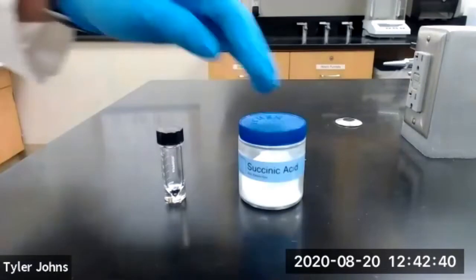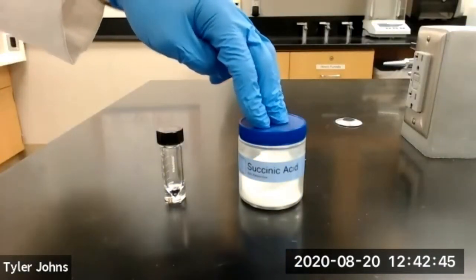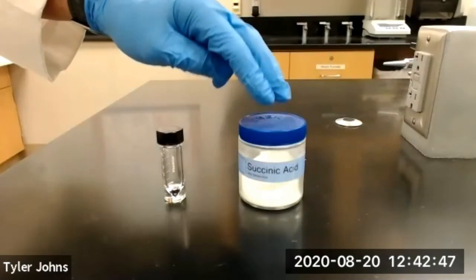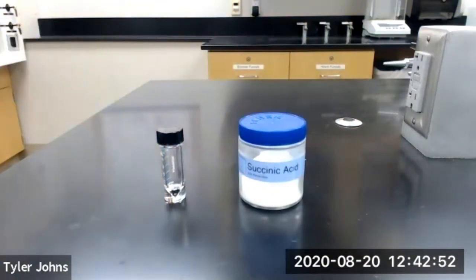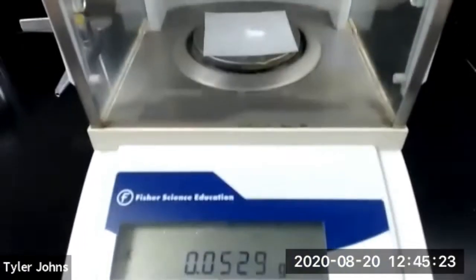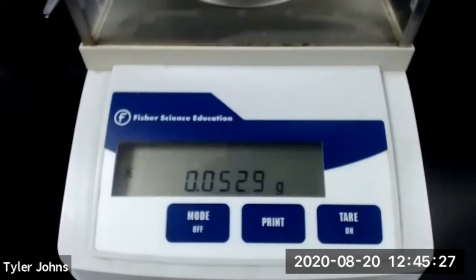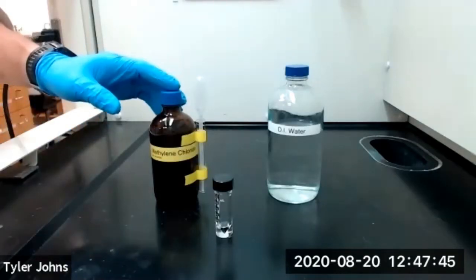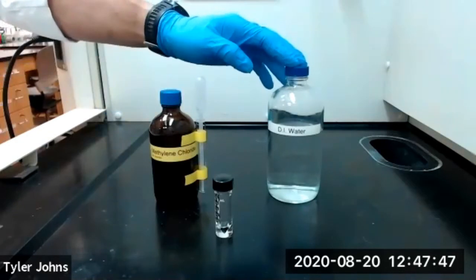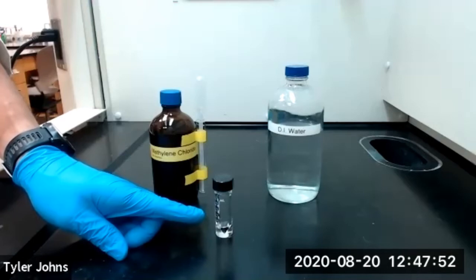We'll now repeat the procedure using succinic acid instead of benzoic acid. We first need to transfer approximately 50 milligrams of succinic acid to a 5 milliliter conical vial. The mass of succinic acid is 0.0529 grams. We'll now add 2 milliliters of methylene chloride and 2 milliliters of deionized water to our conical vial with our succinic acid.